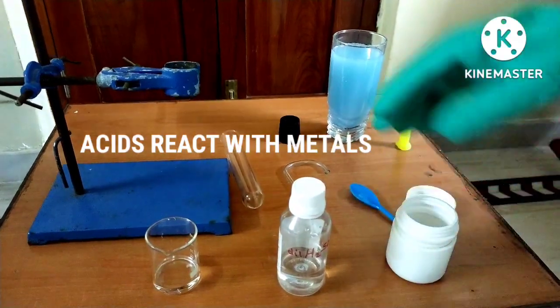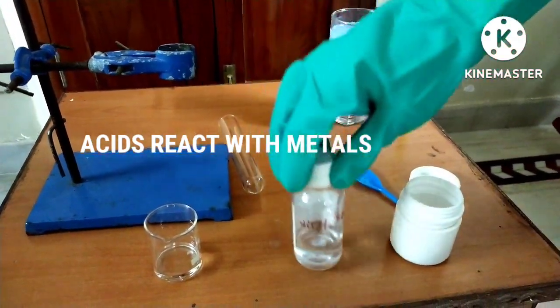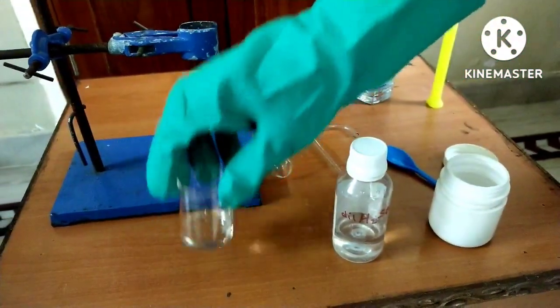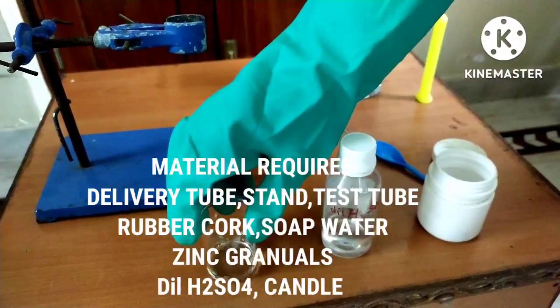Hi Friends! If an acid reacts with metal, what happens? Let us do the experiment.